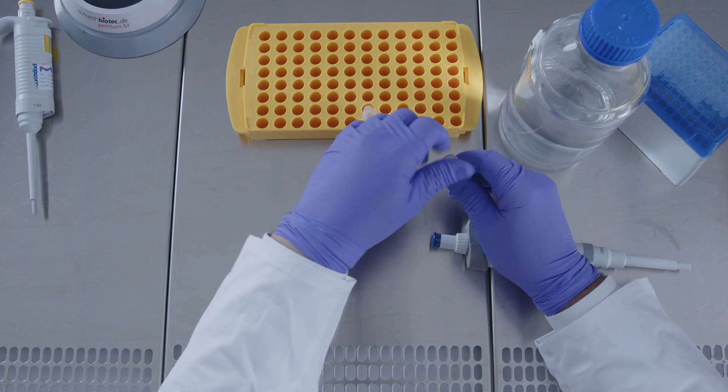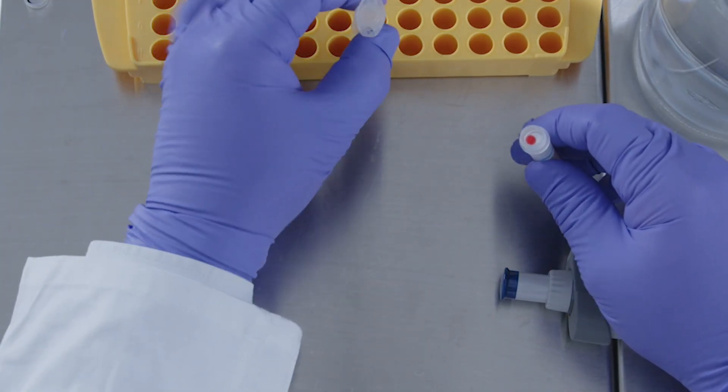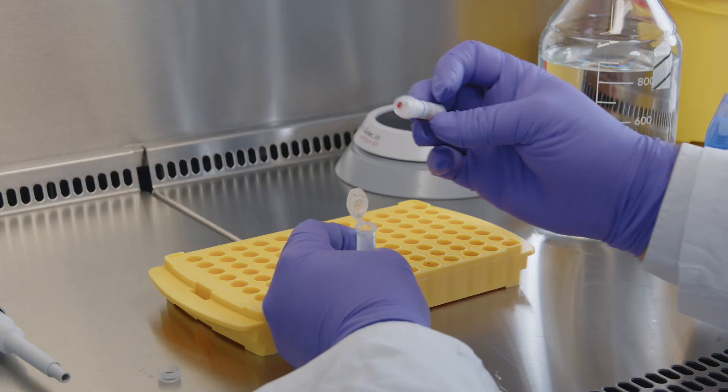Take a vial that has reached ambient temperature. Open it and drop the disc into the buffer or medium to be used.